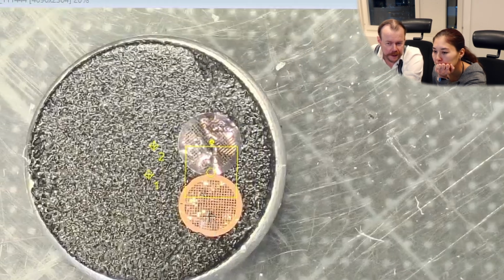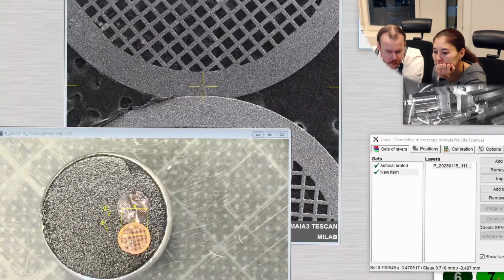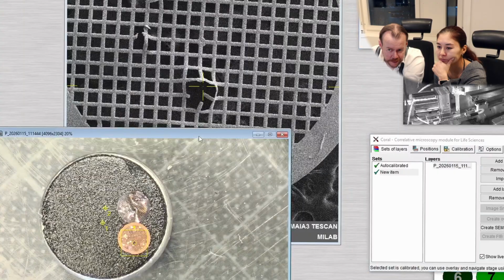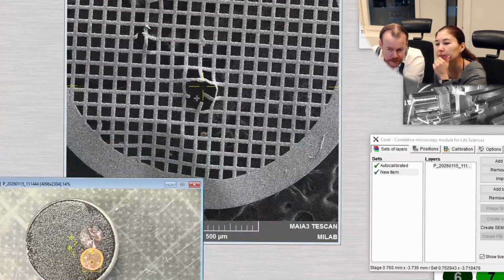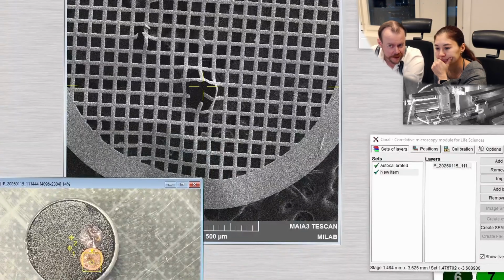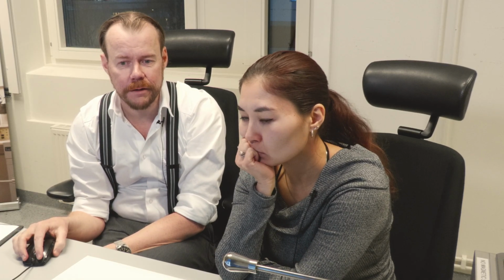Yeah. And then I can click also. Let's say I want it, that's the hole where I put the tweezer in, right? Yeah. If I double click on that, it moves the SEM to that hole now. I see. Okay. So now I can see, here is a hole that I see in the photo, and then I can investigate. It's very handy when you have features you can't see in the SEM, but they are clearly seen in optical micro. I took this with my mobile camera, but you can do it all with the optical microscope. Any kind of digital images work. So this is a very handy thing to have that kind of map tool.